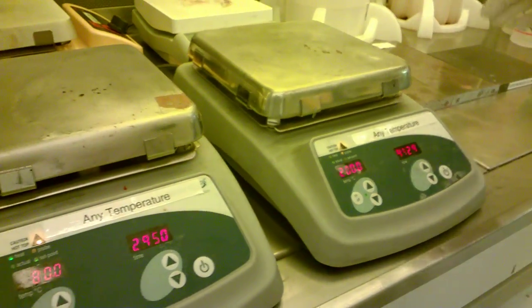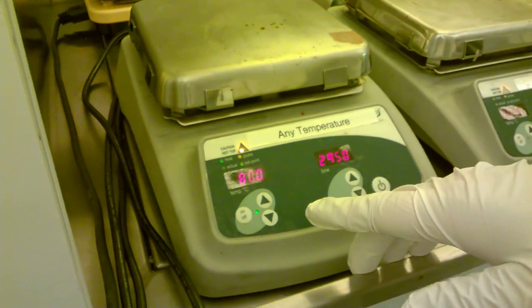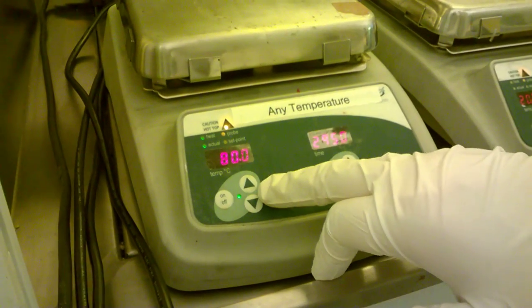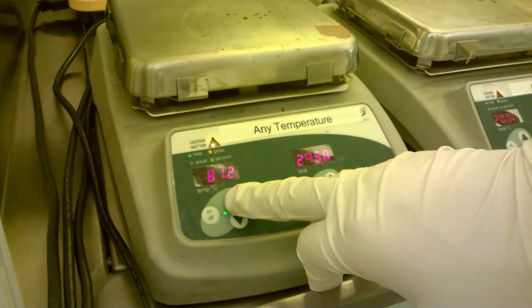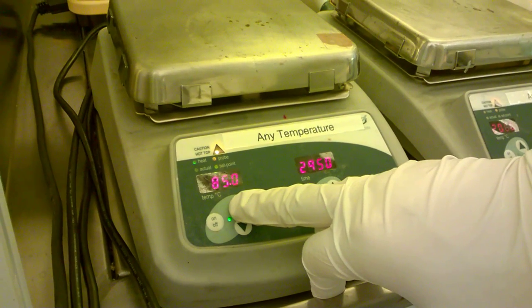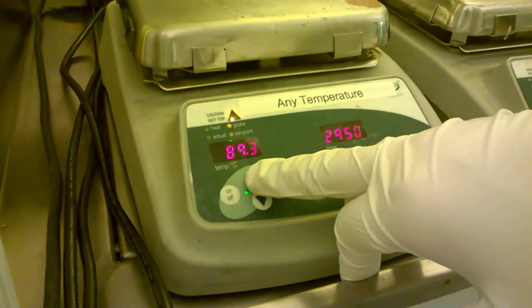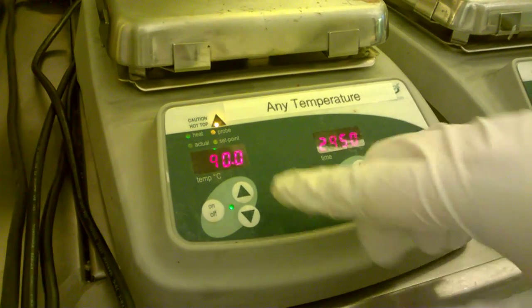This one and this one, you can use any temperature. If you want to change the temperature, you just need to go up and down, press up and hold that for a while. We can go to 90 degrees C.